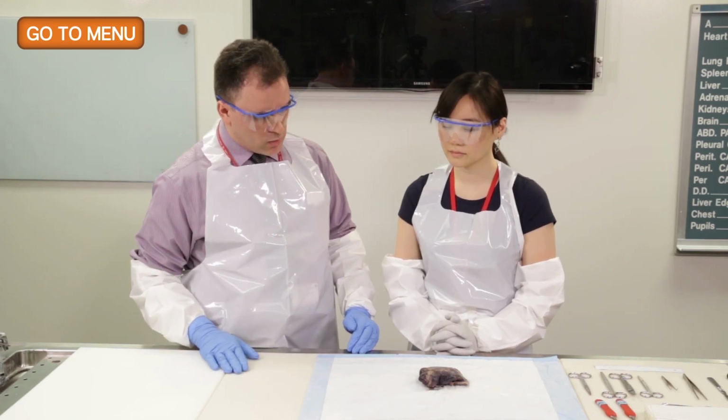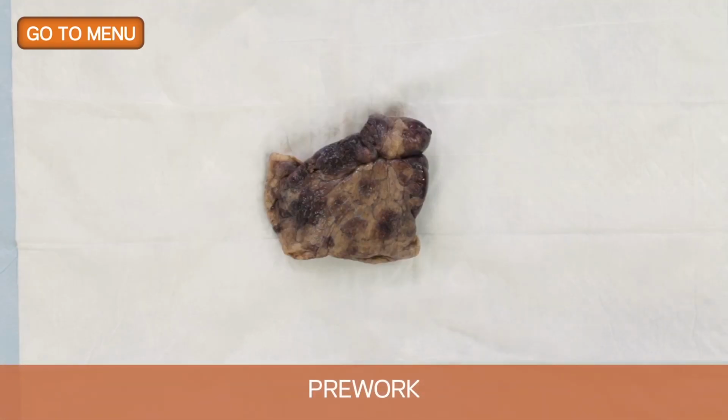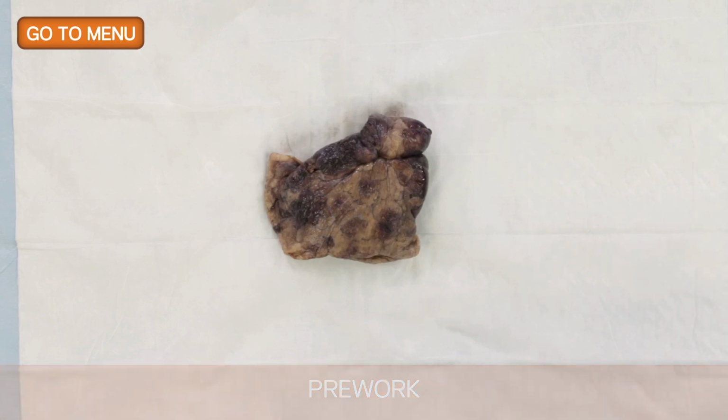We need to make sure that the specimen is correctly labeled and came from a particular patient. This was already done prior to us taking the specimen out, but we do need to make sure of specimen identification. At that point, we need to check the medical record. We need to check the medical record for a variety of reasons.